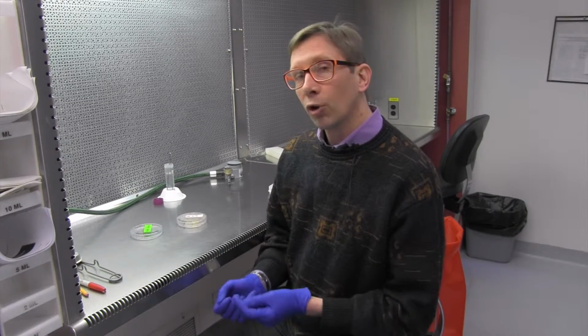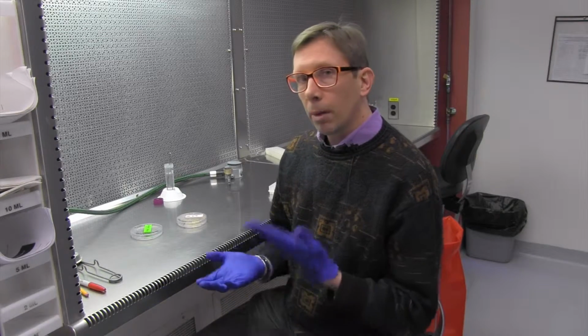Also, between different varieties, sometimes they're not compatible. So if you have a tree that exhibits some really good phenotypes, like resistance to disease or larger pod size, you want to propagate that specific genotype. And the way that you'd have to do it is through tissue culture.